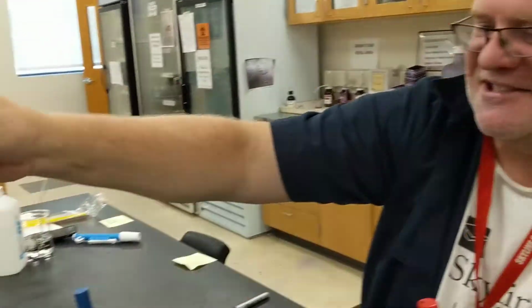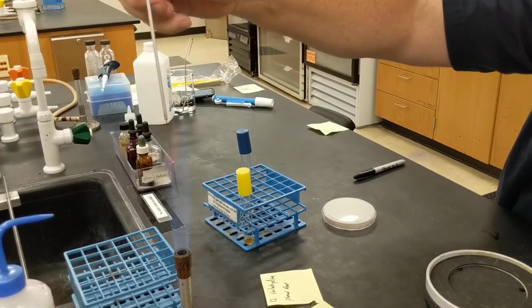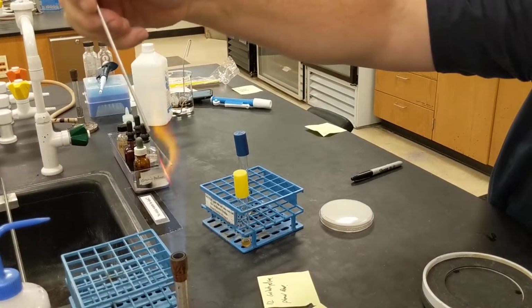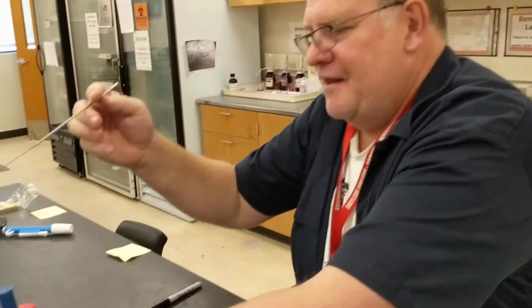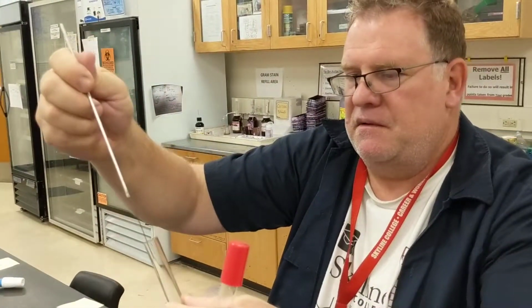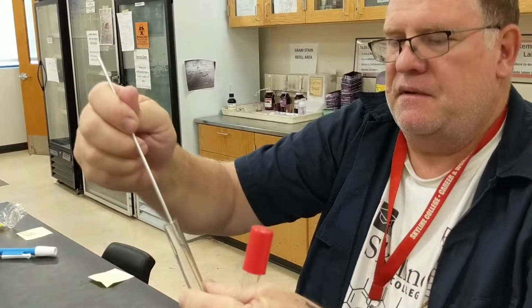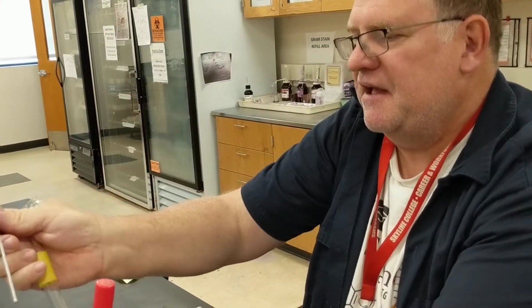All right, so how we inoculate this, Jannar needs a little bit more coffee this morning, is you are going to flame your loop, get it all red hot. Oh, I'm feeling for you. I really need to get that.